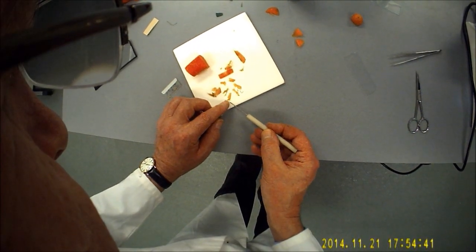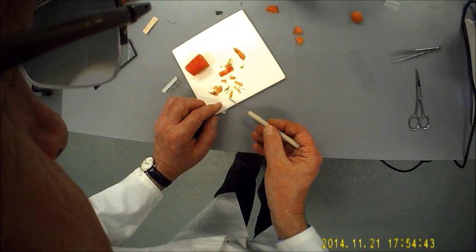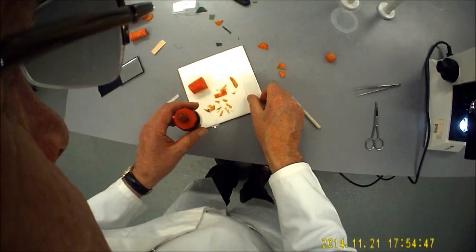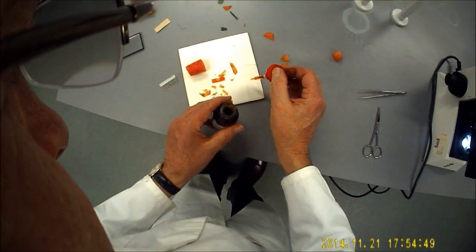That one there is not bad at all, so I'm going to keep that to one side. I'm going to put a drop of iodine on the slide.